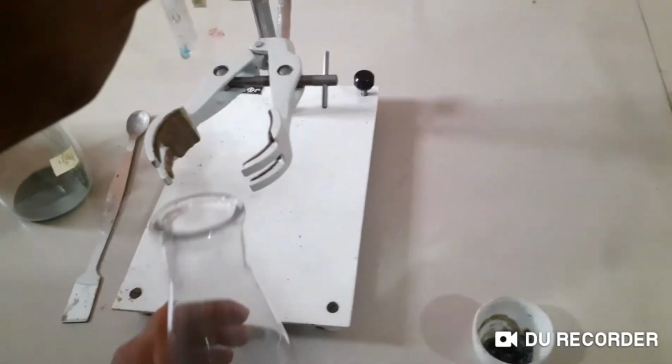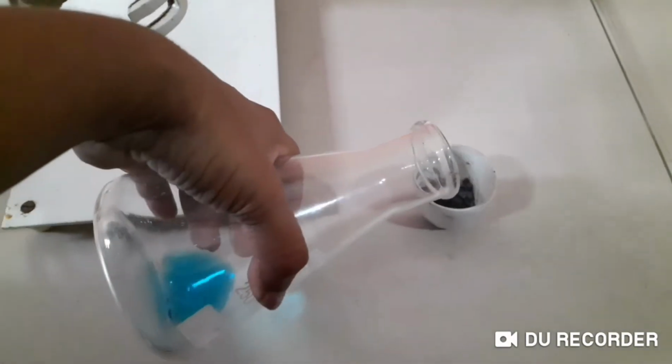Okay, thank you. You can keep it. It's okay. Right, we are going to pour it into this. Sorry. What is that?